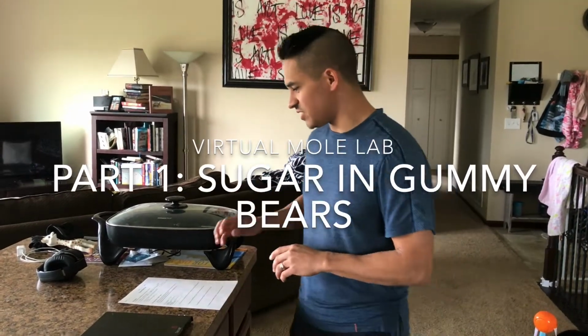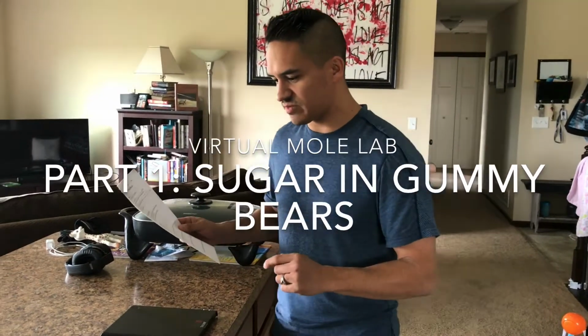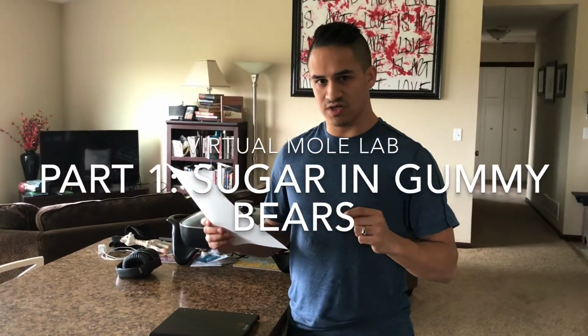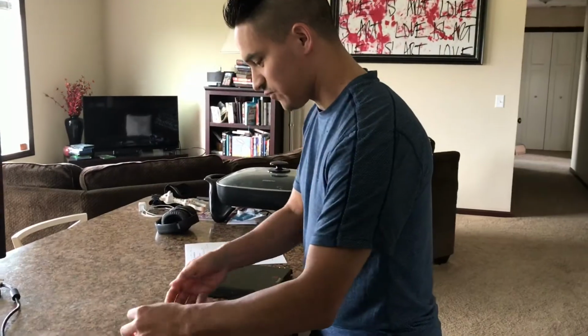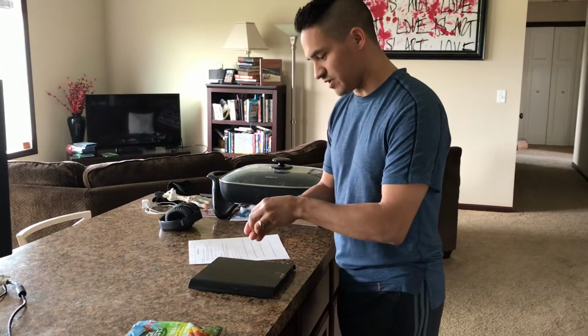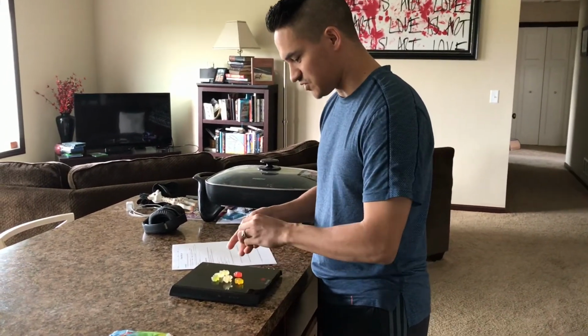So we are going to be doing the virtual mole lab. And in this part of the lab, we are going to be determining how many moles of sugar I consume when I eat this many gummy bears. So what we're going to do first is take 8 gummy bears and put them on the scale and see how many grams of sugar this is.